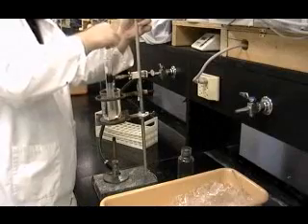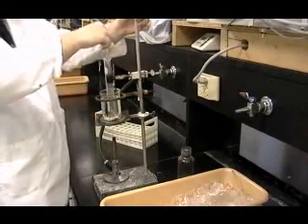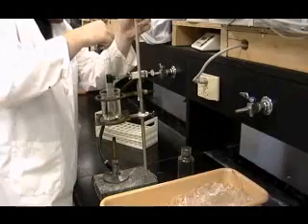Then, stir the contents of the test tube well for 1 minute. If solid remains at the bottom of the test tube, notify your instructor.